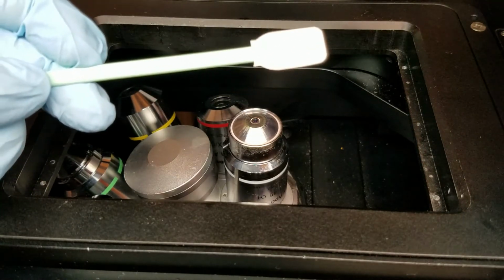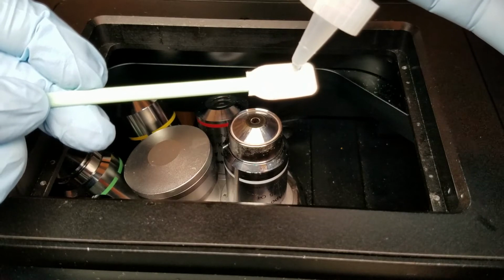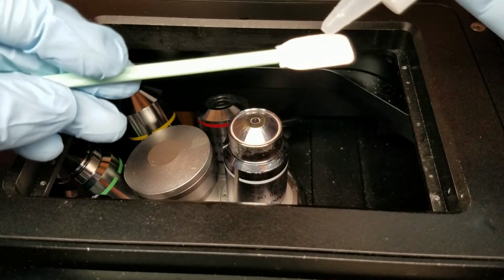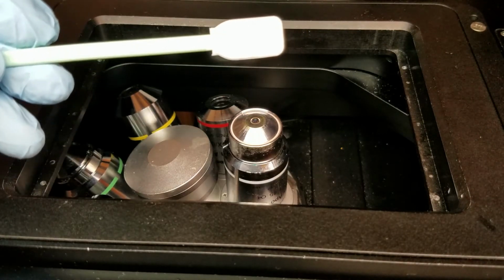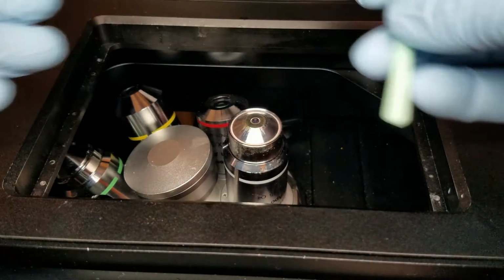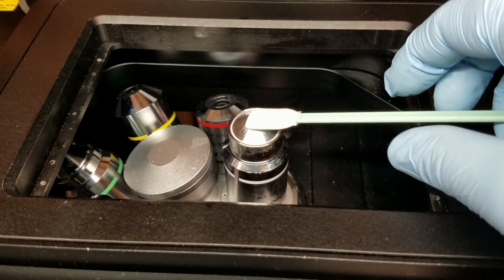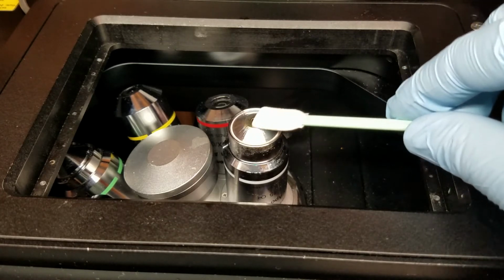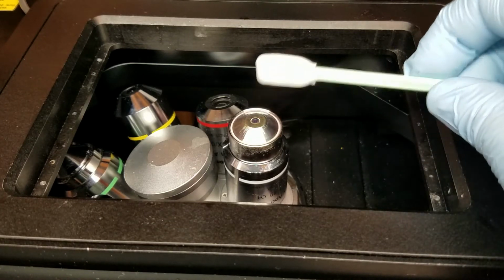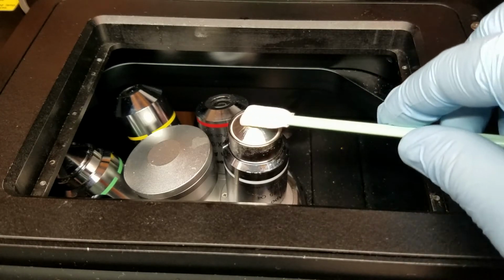Okay, so I'll just turn this over. I'll use the lens cleaner for right now. It's also a Nikon product, which I happen to have. Okay, so I just get it moist. It's not too bad, right? And now what I'm going to do is I'm just going to set this onto the objective. I'm not pushing down, letting gravity do the work. And then I turn this in one direction 4 or 5 times, flip it over, let gravity be our friend, do the work, and turn it for us again.